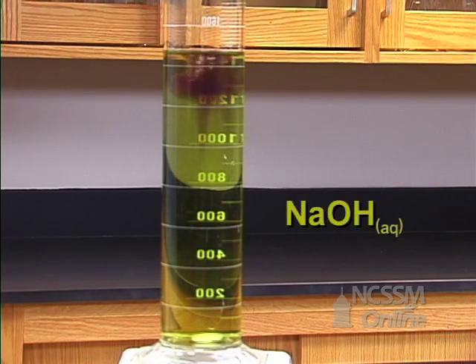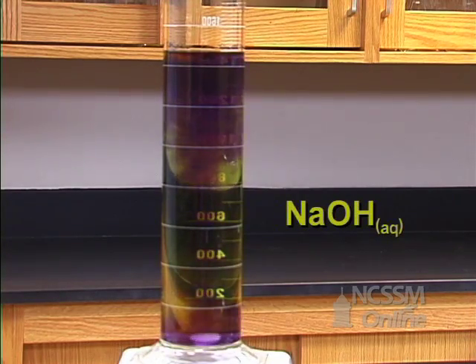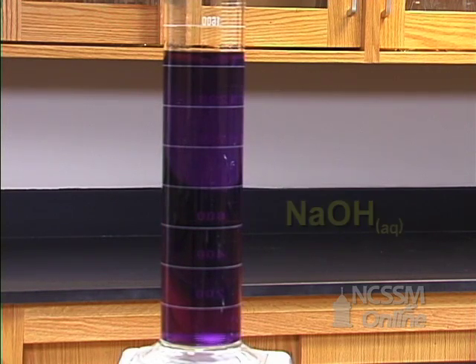I'm going to make this solution basic by adding some six molar sodium hydroxide. I'm then going to add some carbon dioxide in the form of dry ice.